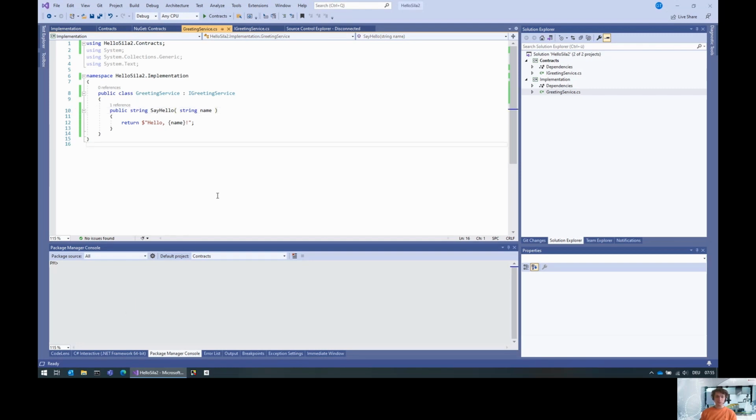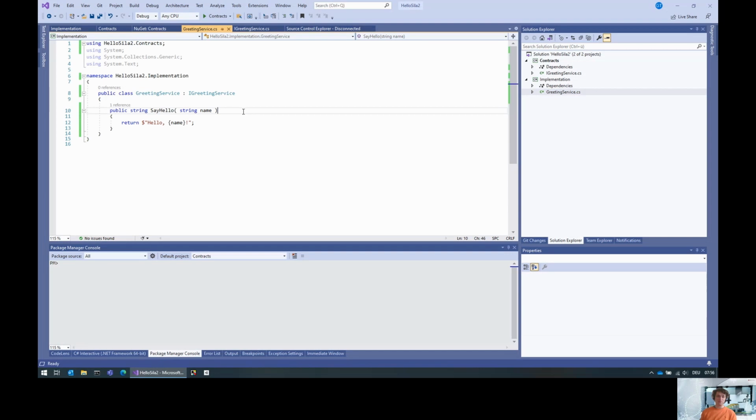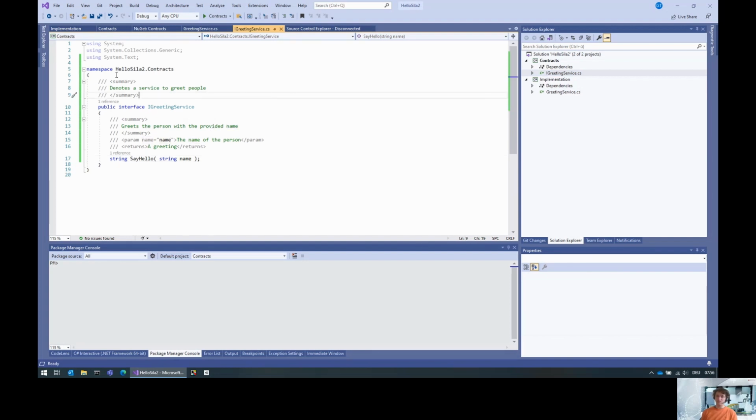For this, I already prepared a solution with an API that we would expose to SiLA 2 in this tutorial, which consists of an interface, which is a greeting service with the only method to say hello and returning a greeting for the person with a given name. There's of course also an implementation which basically just does a string interpolation. So not really a fancy functionality, but it's basically a placeholder for functionality you could expose to SiLA 2. The question is, how do we expose this super sophisticated functionality as a SiLA 2 server?